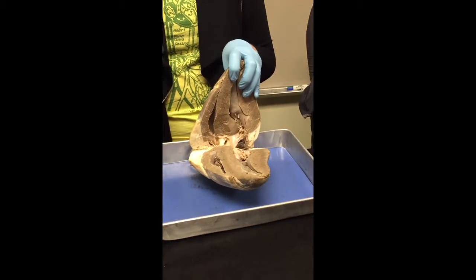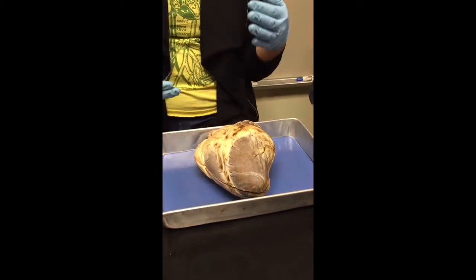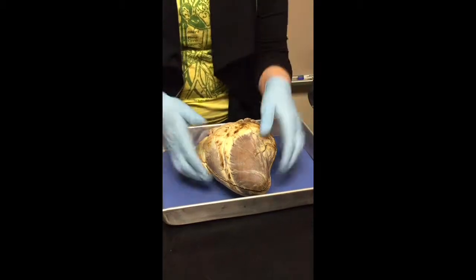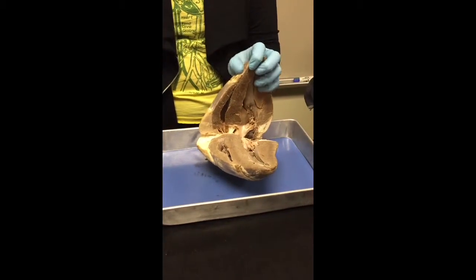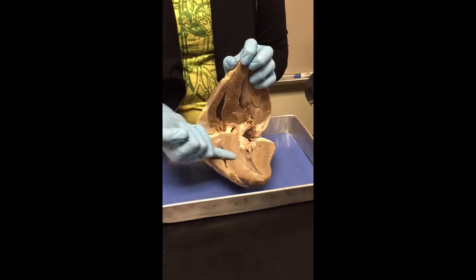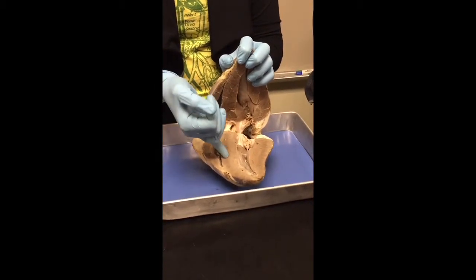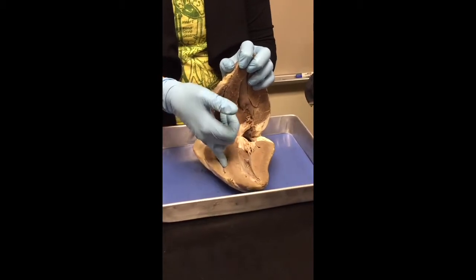How do you know, like on the test, am I asking ventricle? Am I asking the tissue type? Like what is it that I'm asking from the heart, right? So you'll know what I'm asking because I'll have a note card right next to each station, and the note card will have questions on it that go along with the numbers. So if I have a pin in here, I'll have a note card next to it and say, what is this specific type of tissue? You would say myocardium.